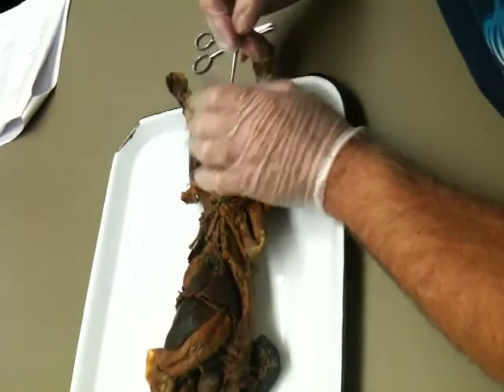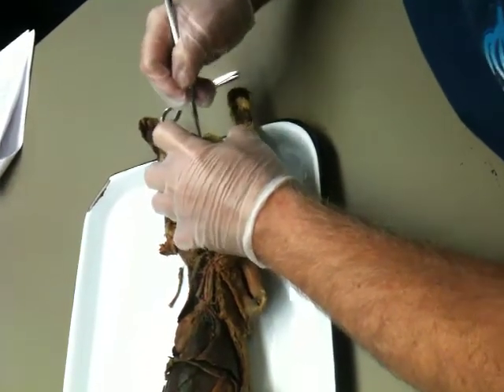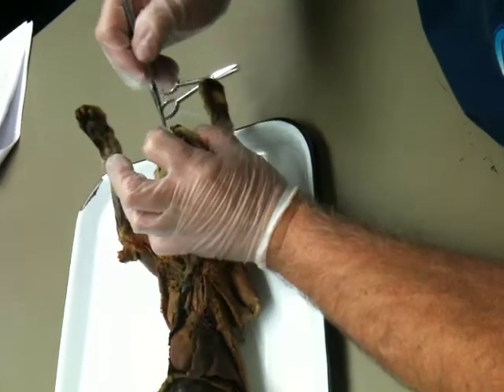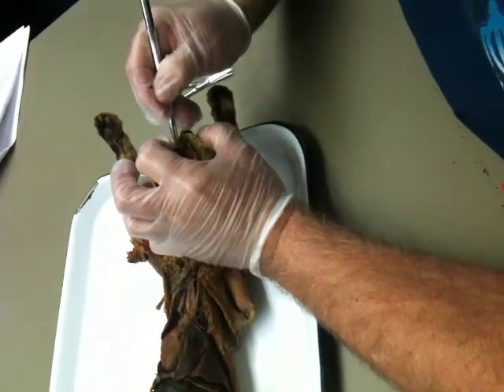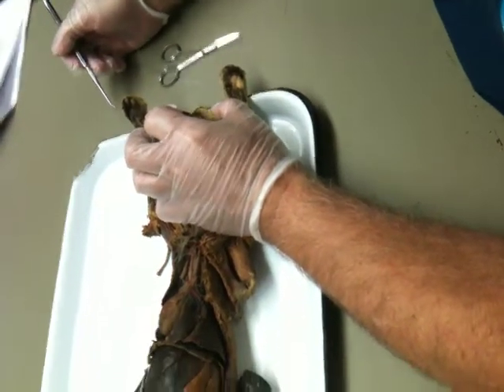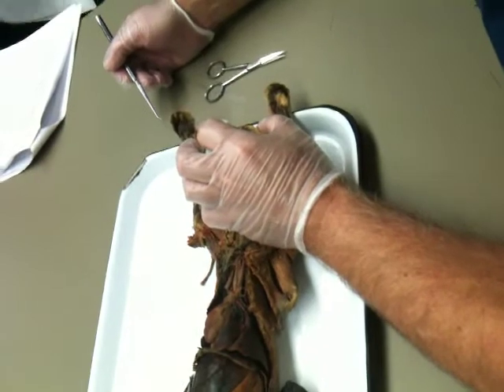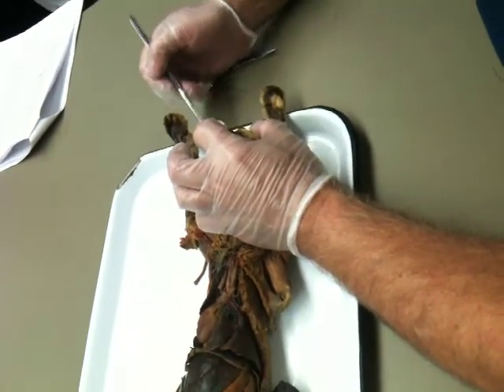Back to the mouth. The hard palate is ribbed in the cat. Most of you are going to have to take my word for it for a moment, okay? And then I can put the probe back and feel the soft palate. Okay. Some of these are just too easy, aren't they? After all you've learned, hard palate, soft palate.